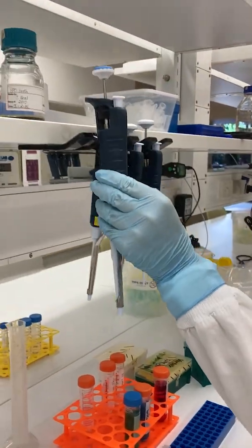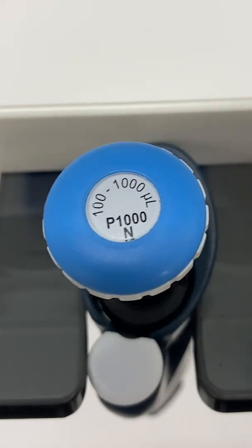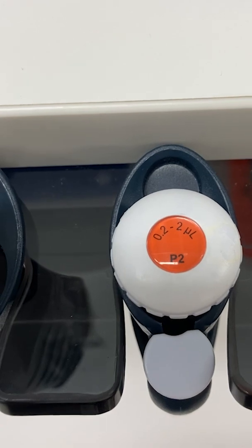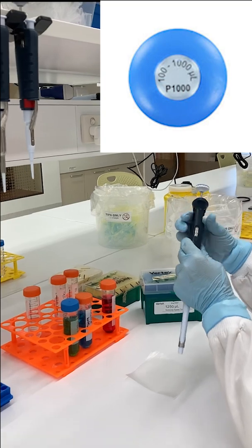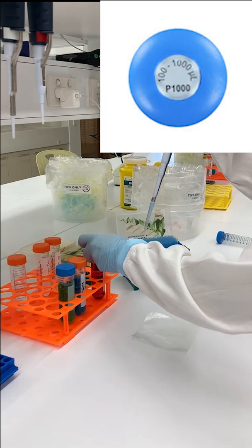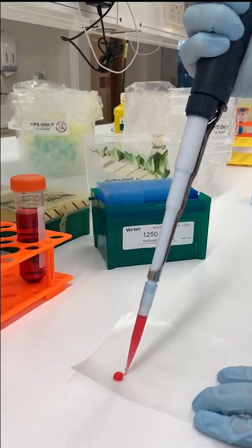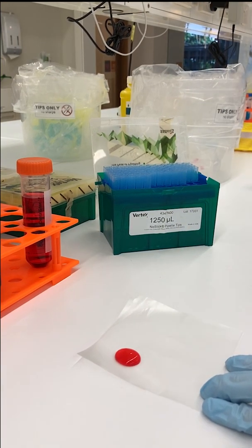At SPARQ-ed, you will use Gilson pipettes. The Gilson company makes a series of these, each with a specific range of volumes that it can measure. You can distinguish the pipettes by the number written on the top of the plunger. A P1000 pipette can dispense liquids of 1 milliliter, which is 1,000 microliters, down to a minimum of 100 microliters. One milliliter is equivalent to the volume of a block that is 1 cubic centimetre.